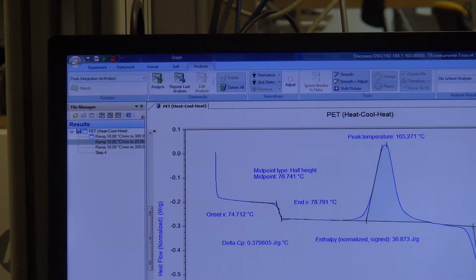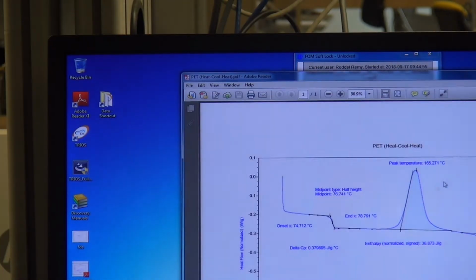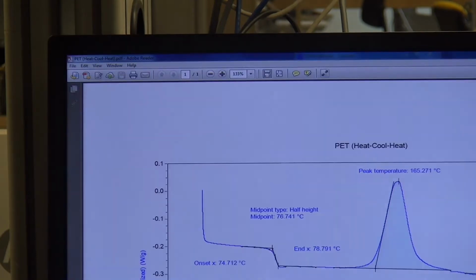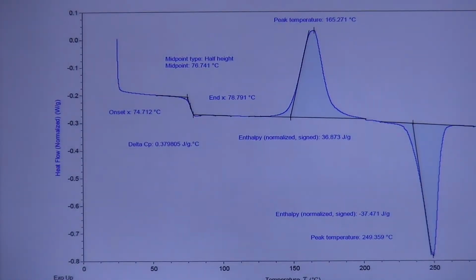And if I go to my desktop, this is my PDF. The PDF basically contains all of the things I just analyzed: the title, all the X and Y axes, my convention of exothermic up. Everything is added to the PDF. So you can basically save that and take that with you.